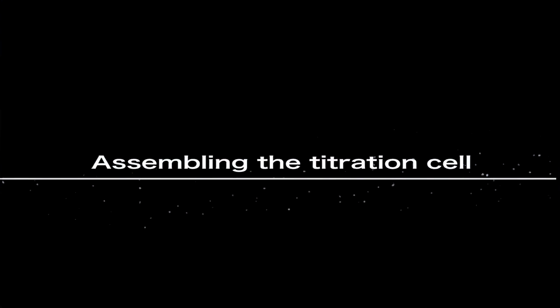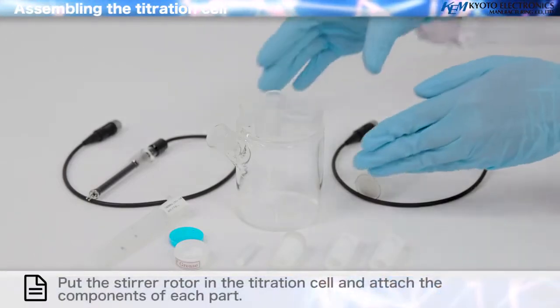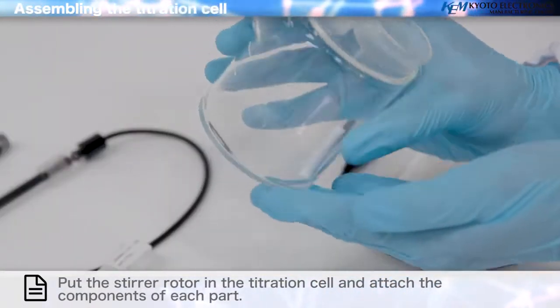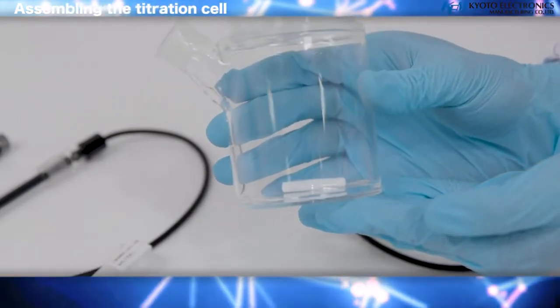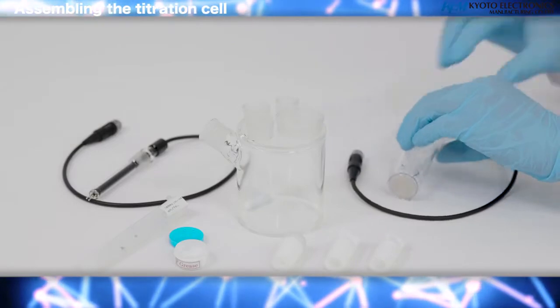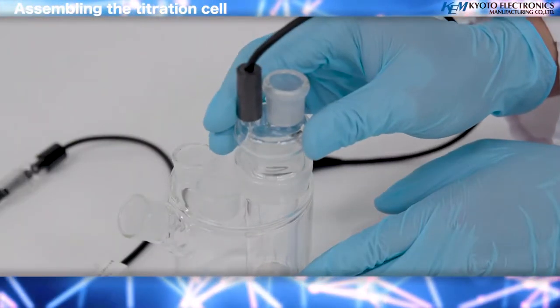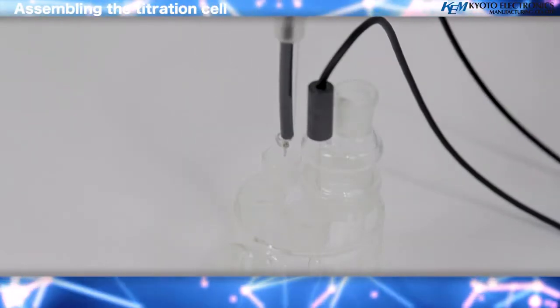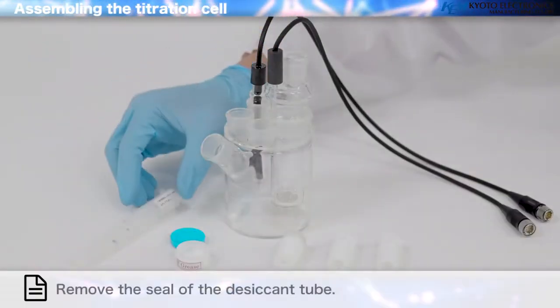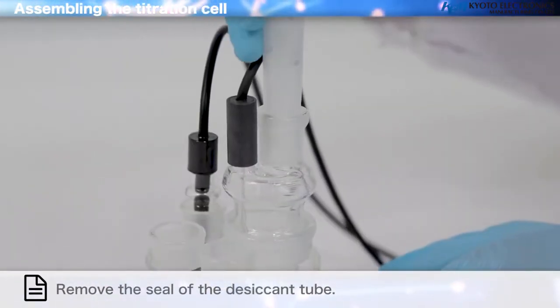Assembling the titration cell. Put the stirrer rotor in the titration cell and attach the components of each part. Install the inner burette. The detection electrode. The desiccant tube. Remove the seal of the desiccant tube.